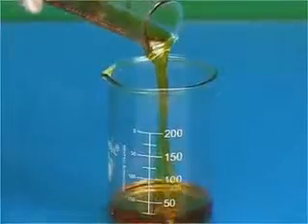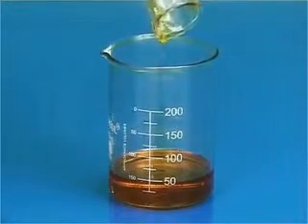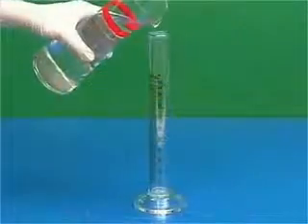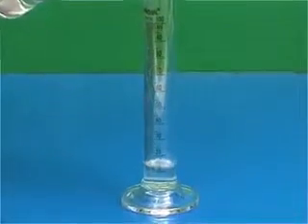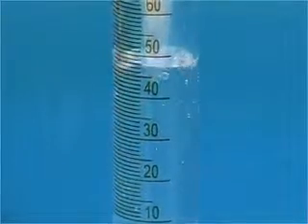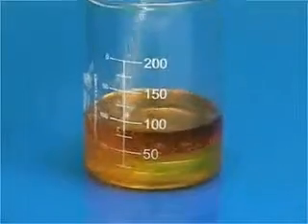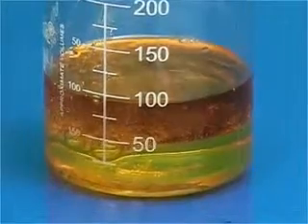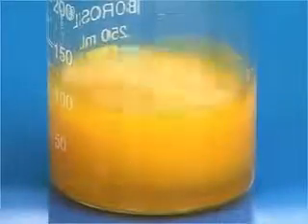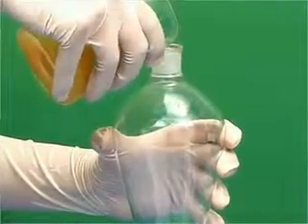Take a beaker and add 50 milliliters of mustard oil in it. Next, add 50 milliliters of water in the beaker and stir with a glass rod. Take the separating funnel and fill the mixture of oil and water in it.